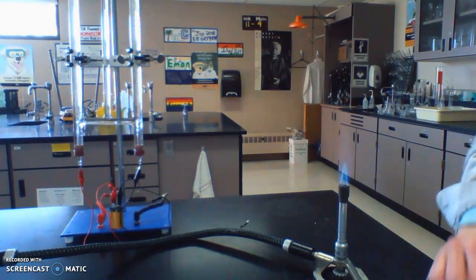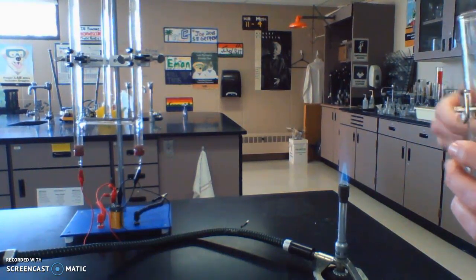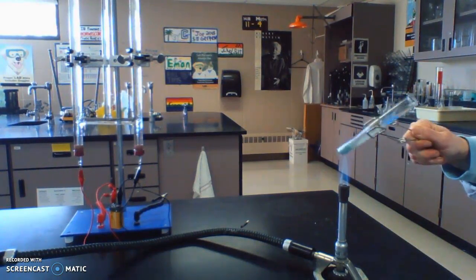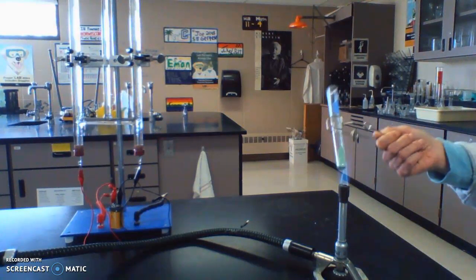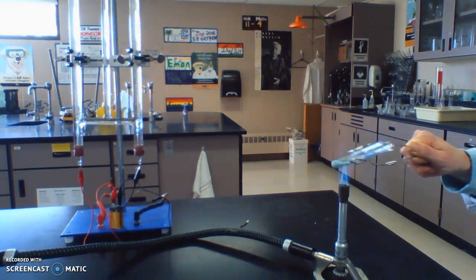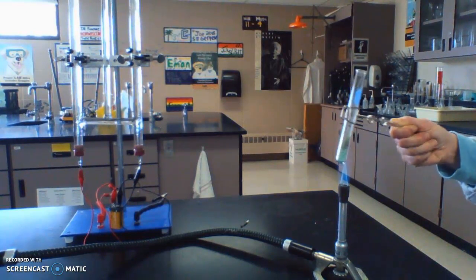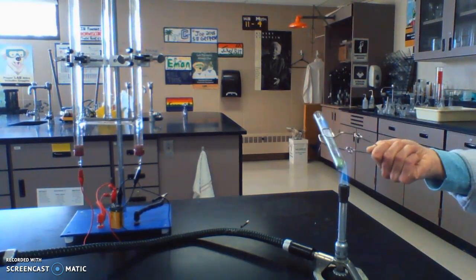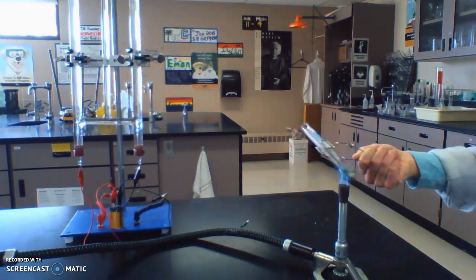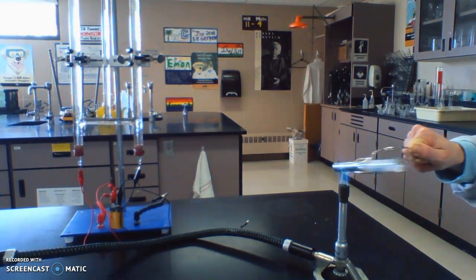I'm going to light my Bunsen burner. You should know what state you should have for this formula. I'm going to hold it in my test tube holder and heat it. Heating it is not the same as burning it - I'm not adding oxygen, just heating it up to speed up this type of reaction.